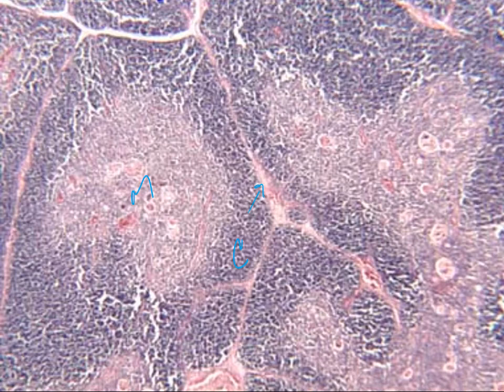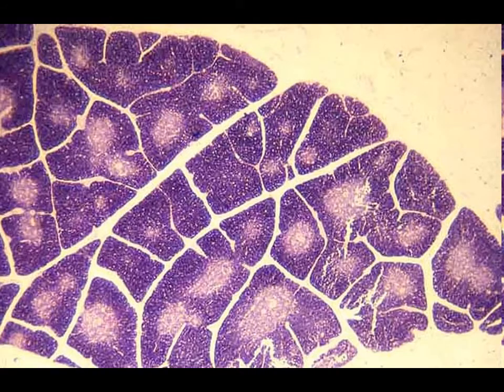So this one's a relatively young specimen. This one is a little bit older. So this particular specimen has a lot larger septum that are there to be seen. We can still see the cortex and the medulla and the differences between them, but we can definitely see how the septum has grown in size in between the tissues themselves.